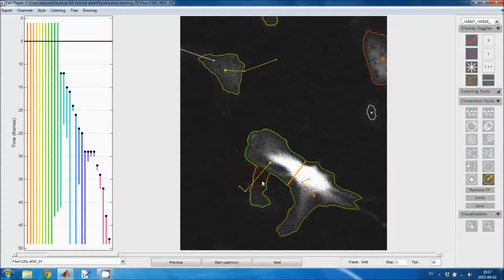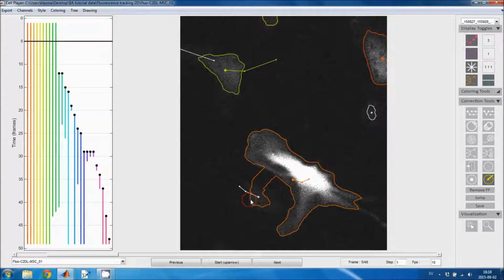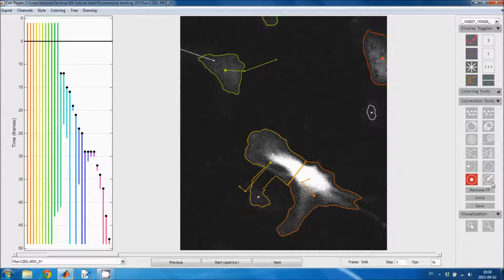There are other possibilities. I'll have to move this one. If you select merging combine, then the biggest region will take over the segment of the small region, and the small region becomes a false positive cell. And then there's a third option, which is overwrite, and in that case the region that you first, I need to separate them first. The region that you first draw on will take over pixels from the second region.